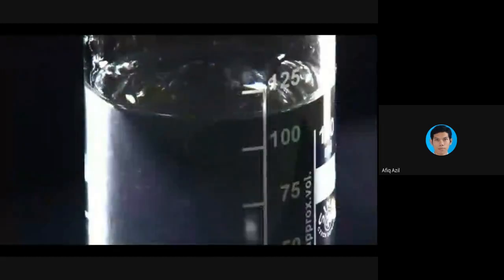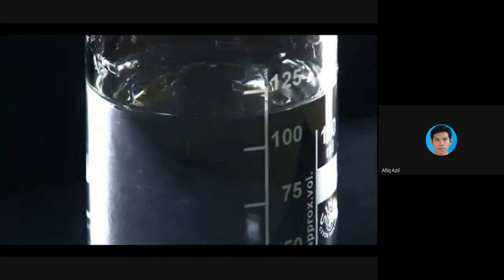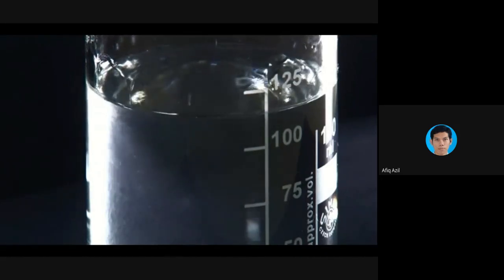Quite often it's difficult to see if two clear liquids are dissolving or not. So look for mixing lines, like these ones that you see here. Even if all of the substance doesn't dissolve, the presence of these mixing lines will tell you that it's at least partially soluble. If you think you have an amine because of the previous tests that you've done, don't put it into concentrated sulfuric acid because a violent reaction will occur.